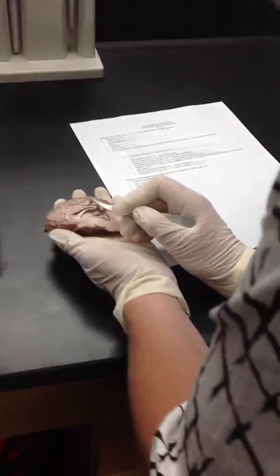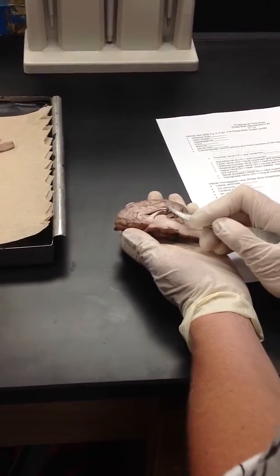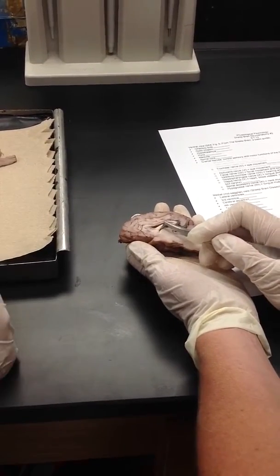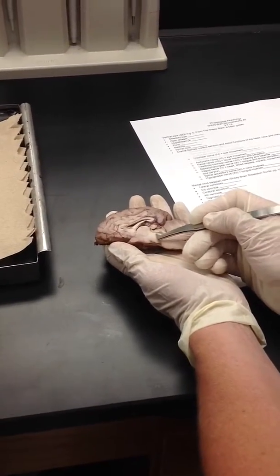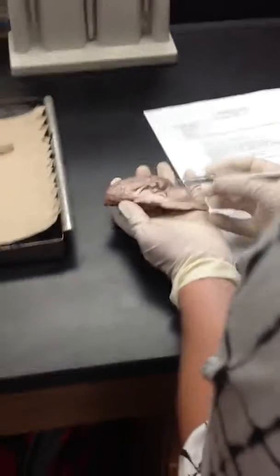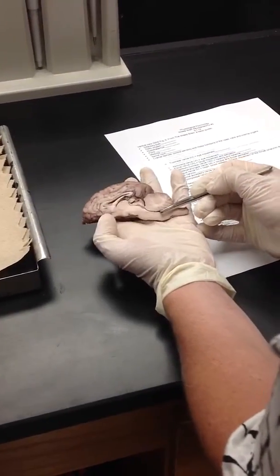All right, so here is the lateral ventricle right here. And this region surrounding this circular structure here is the third ventricle. This groove that you can see coming along here, that's the aqueduct. This deep groove, yes, exactly. And the groove leads all the way back to where the fourth ventricle is, which is here.